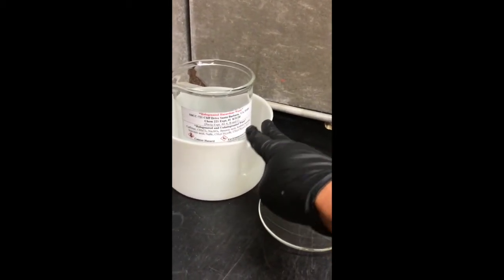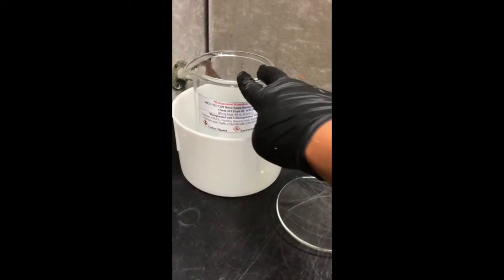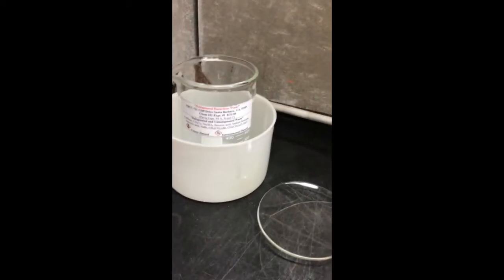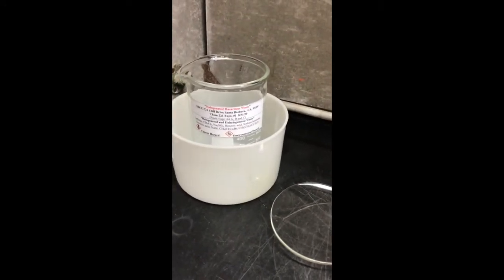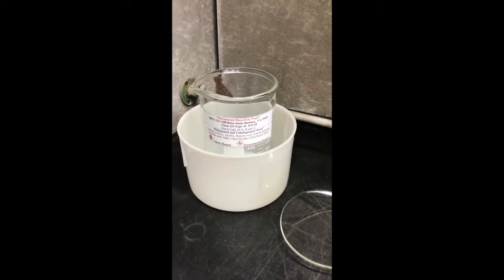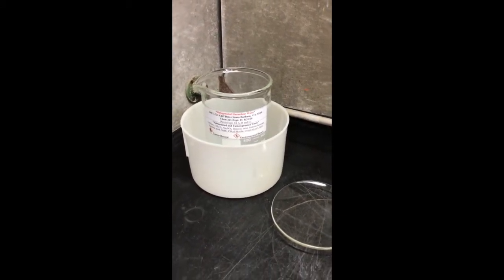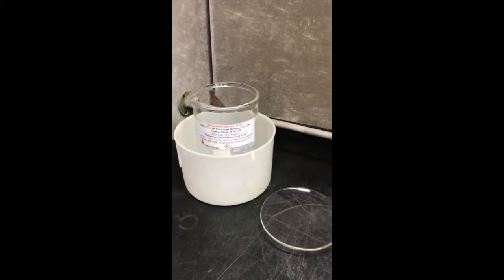Okay, if it's not on here, you need to come to me immediately because you shouldn't put it in there. There's probably another waste container there. Okay, it also has some warnings on there. So we've got a cancer hazard and environmental hazard. So the chemicals that we're using for this lab are pretty gnarly. That's pretty much the case for organic chemistry, though.